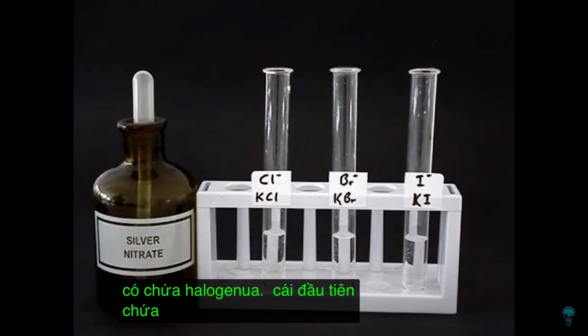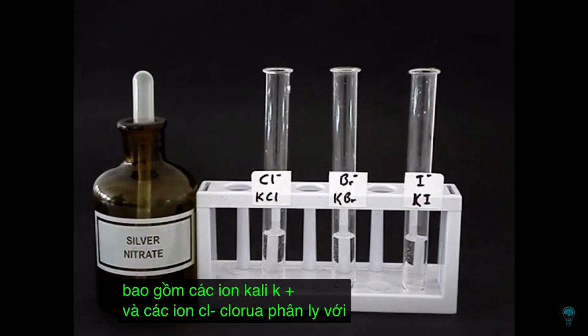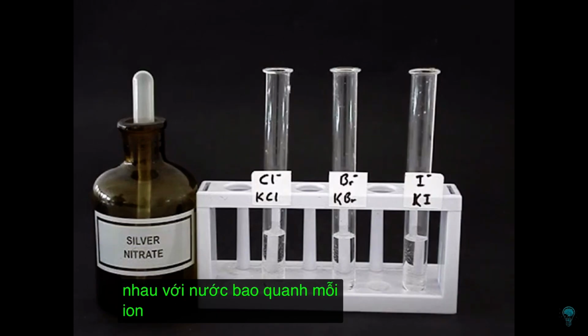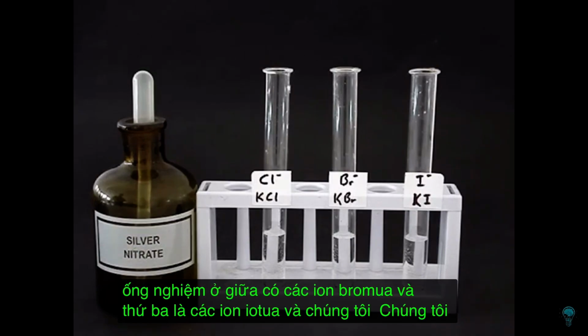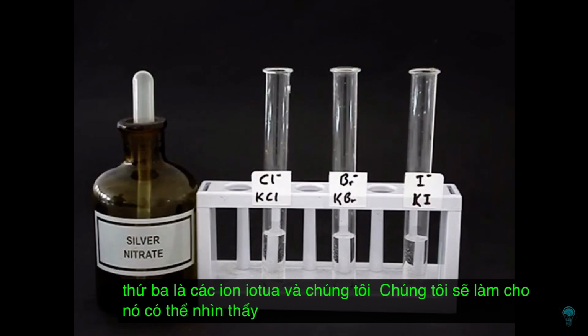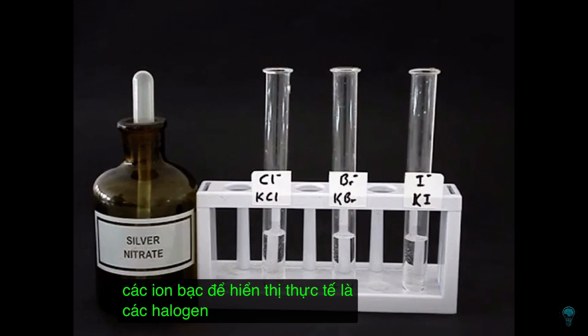The first one contains a chloride, potassium chloride, which consists of potassium ions, K plus ions, and Cl minus chloride ions, dissociated from one another with water surrounding each of the ions, all of the ions. And then the middle test tube has bromide ions, and the third one iodide ions. And we're going to make that visible by adding silver ions to show up the fact those halides are there.